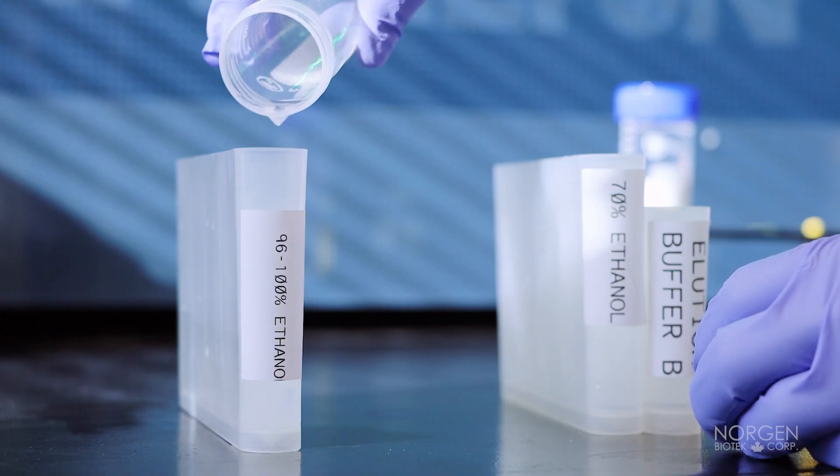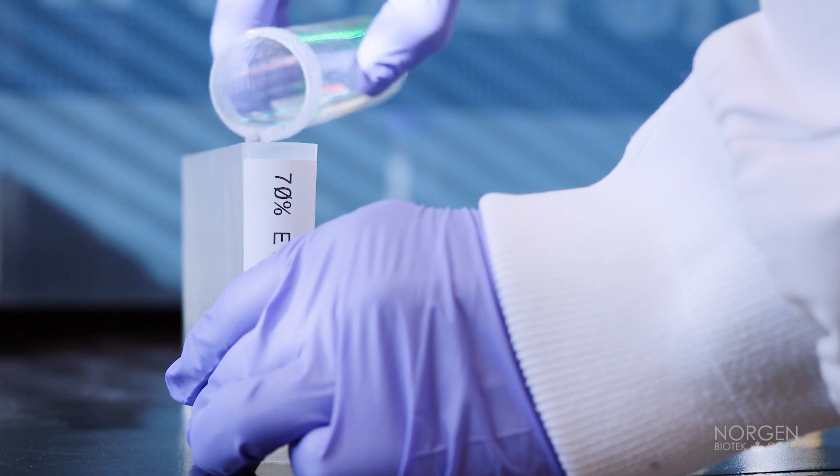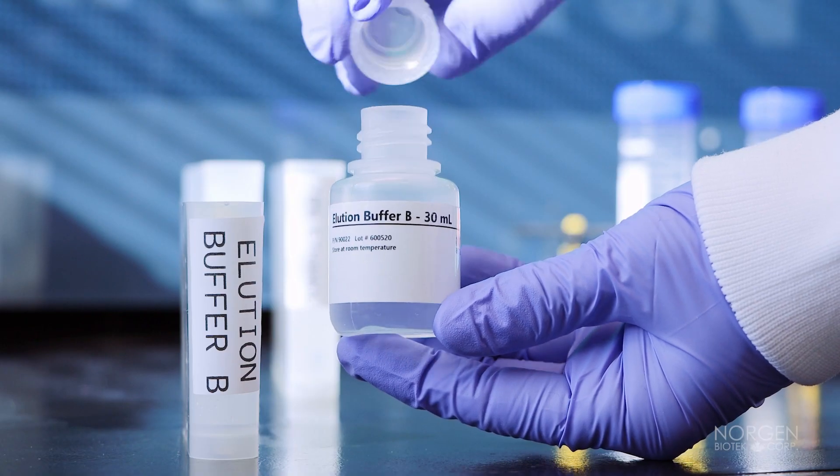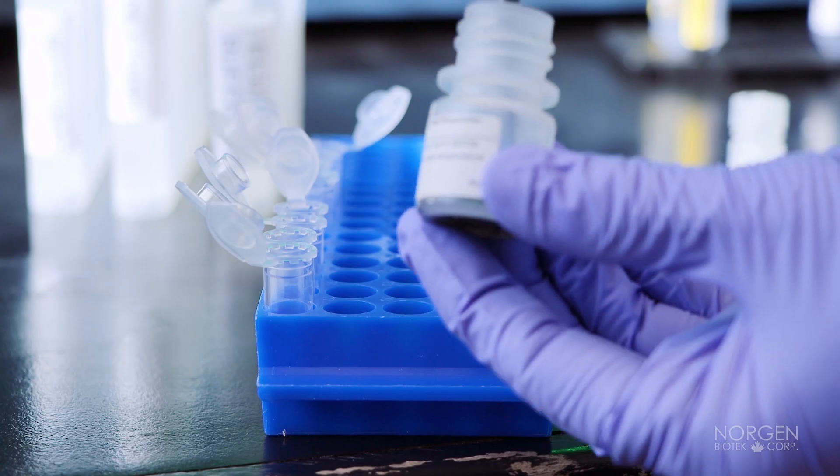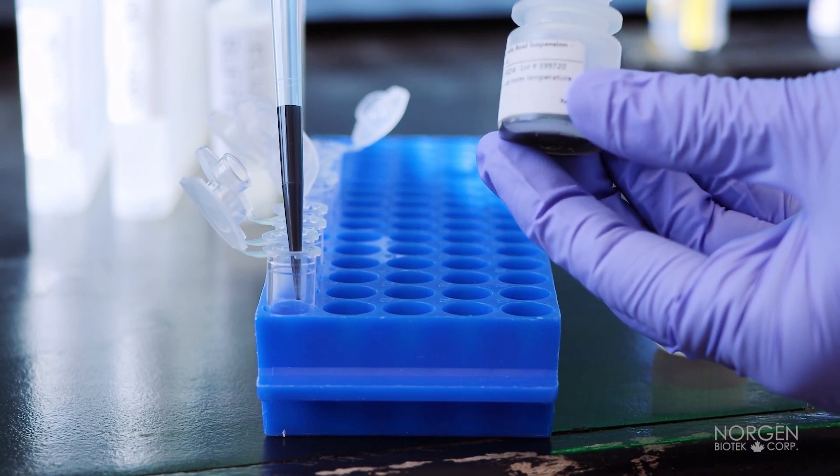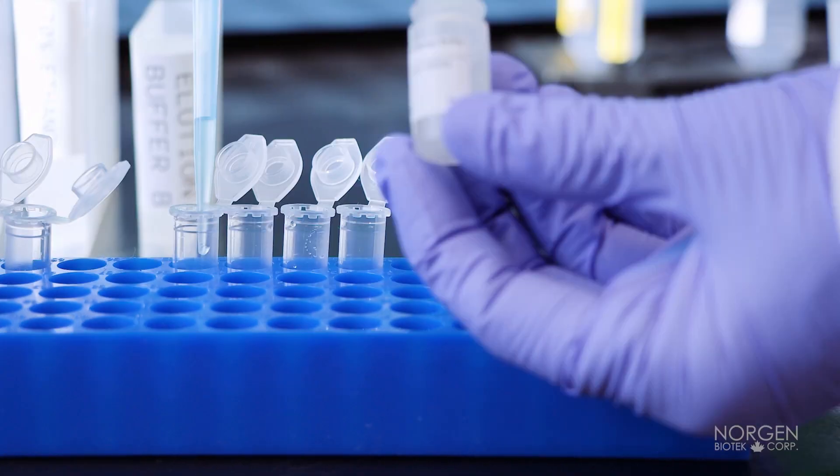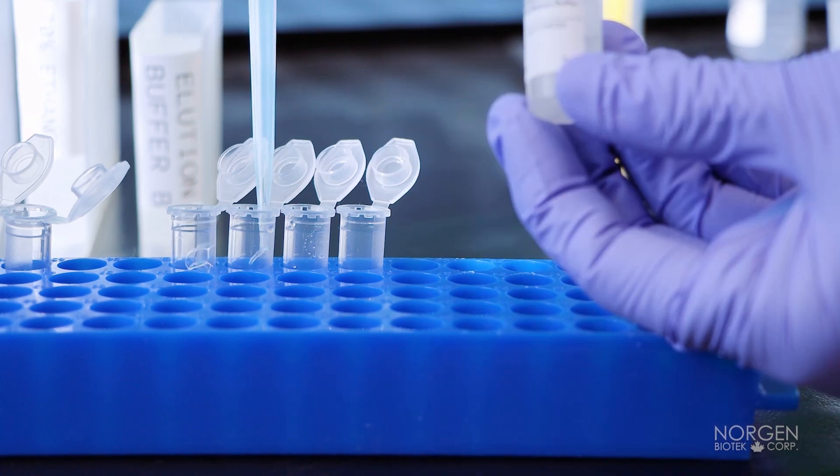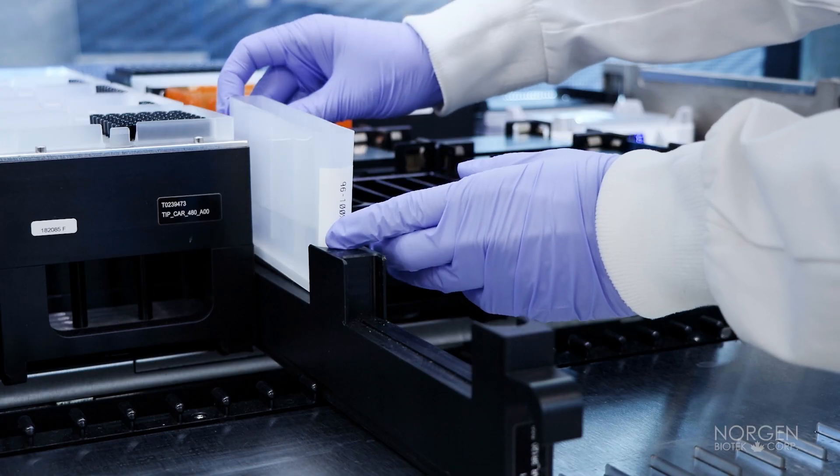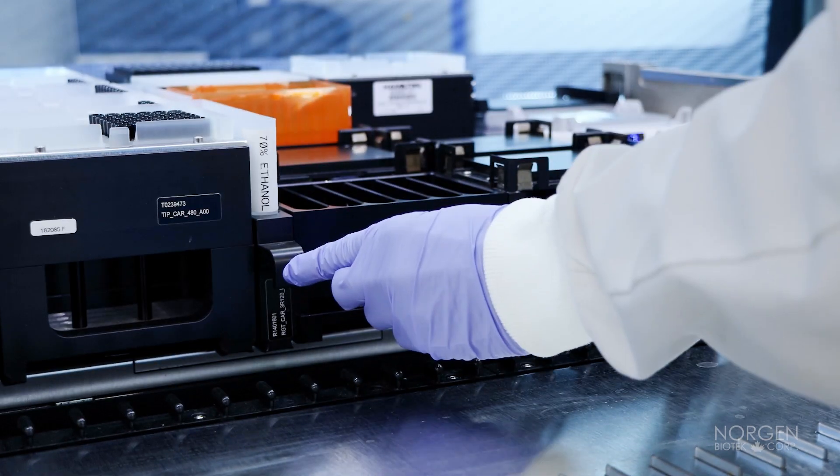Load all of the buffers into Hamilton's supplied reagent containers and load in the positions indicated in the deck setup.